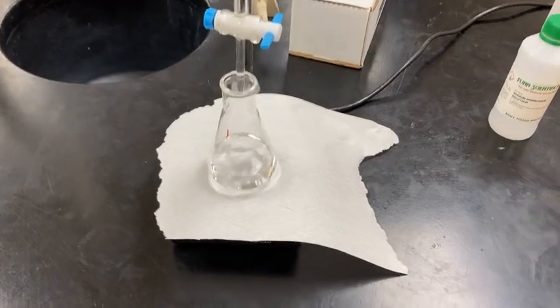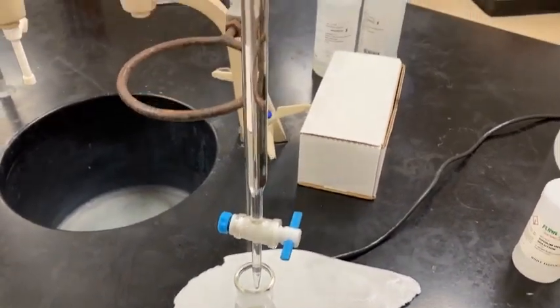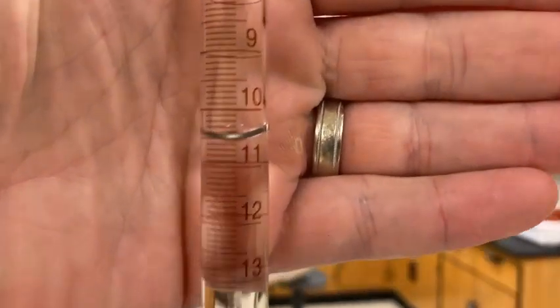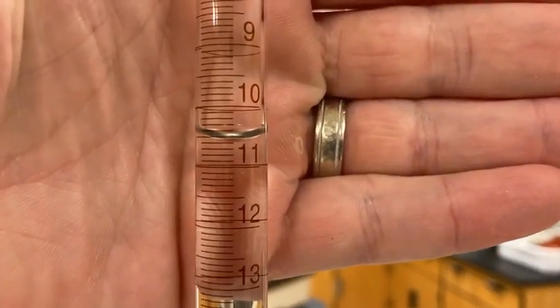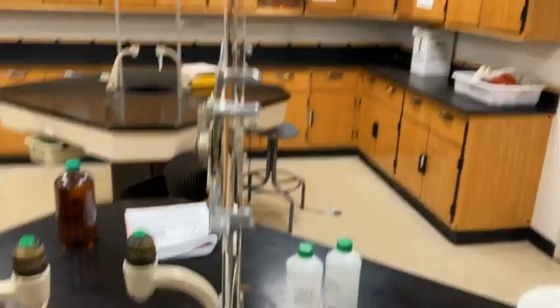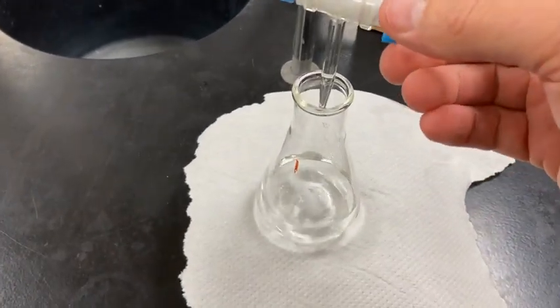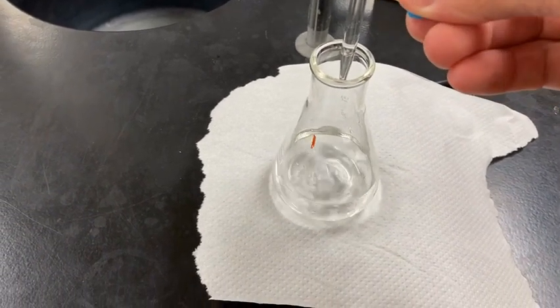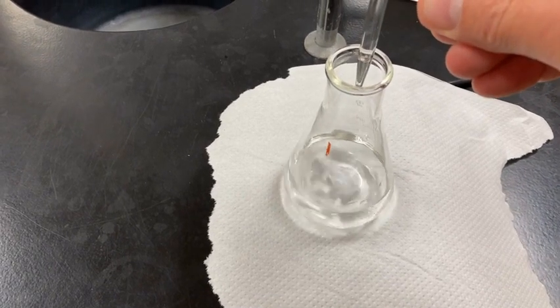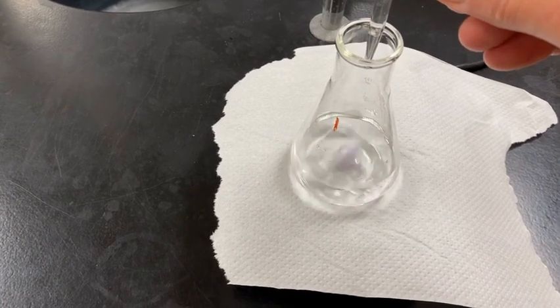All right, trial 1 is all set up. I've added the water, the indicator. Let's go ahead and get the initial reading on our burette. Try to get more eye level with it. There we go. And I want you guys to predict a little bit. What do you think? Is it going to take more NaOH or less NaOH with this potassium that is dissolved in the saturated solution? Take your guesses now. See if you understand the concept, and then I'll start adding the NaOH.